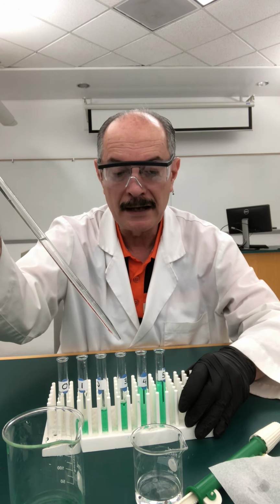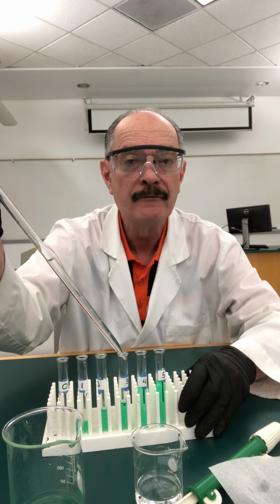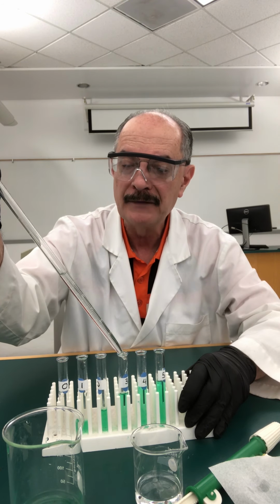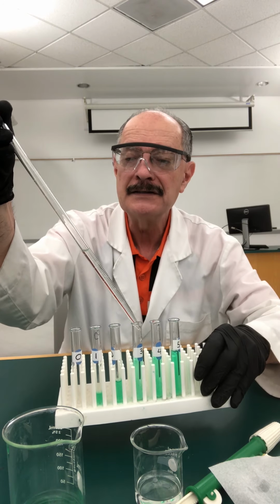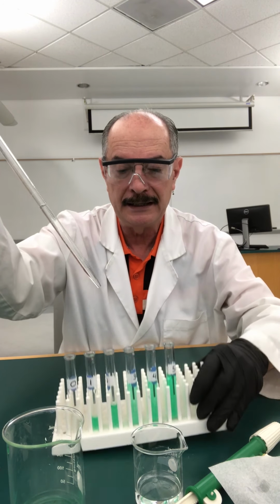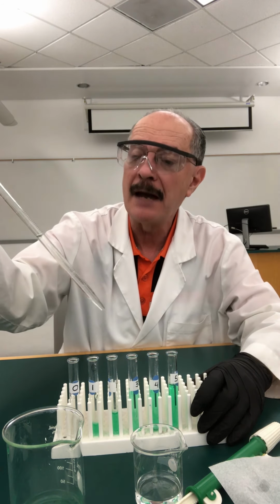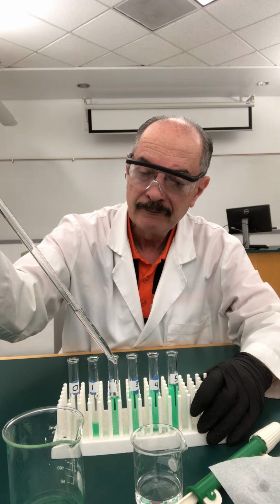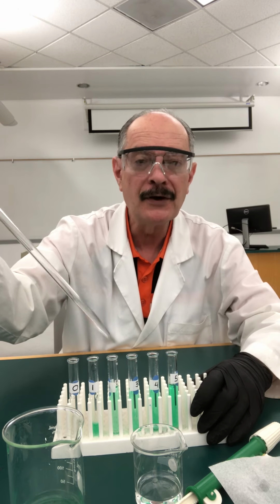The next one requires that I put in 2 milliliters of water, so I'm at 3 now. So where do I go? That's right, I go to the 5, so I'm going to go down to the 5 milliliter mark. Again, notice that I'm always touching it to the side of the test tube so that it'll deliver all the way in. The next one now needs 3 milliliters. I'm at 5, so I'm going to go down to 8, right? And then I'll have to refill. So when I'm done, we'll come back and see the final results.